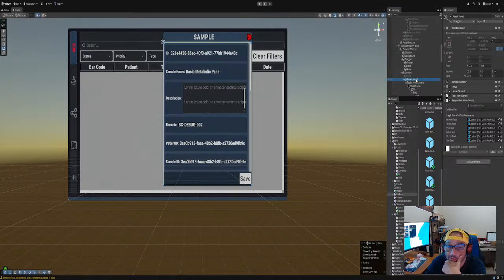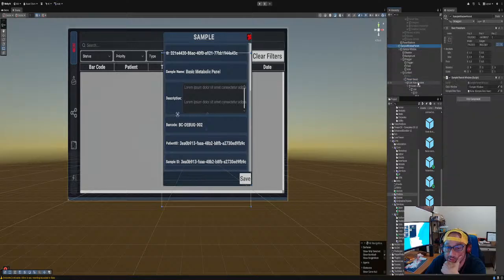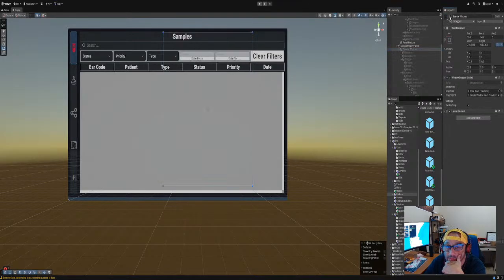It loaded up. All right, cool. All right, sample window parent, and we need a reference to that. There we go. And now let's run it. Close this out, and then we run it and see if it actually works.